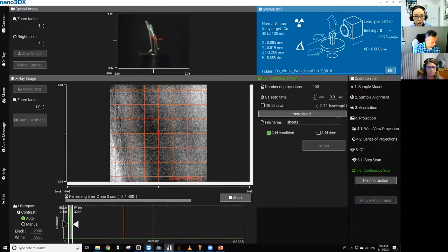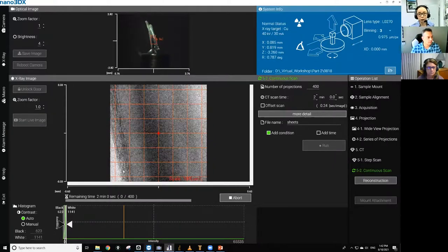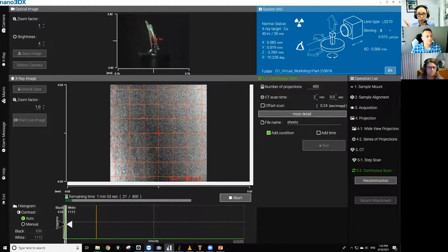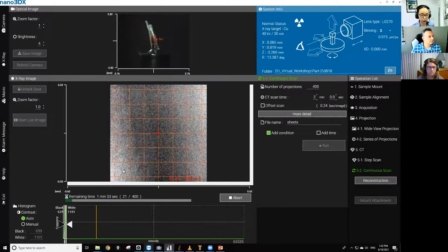If you're wondering what this kind of fibery thing you see here, that's the wax paper that is on parafilm. I don't know if you can picture it. Parafilm usually comes in a roll or sheets, but they have a wax paper-like thing in between so that they don't stick to each other.